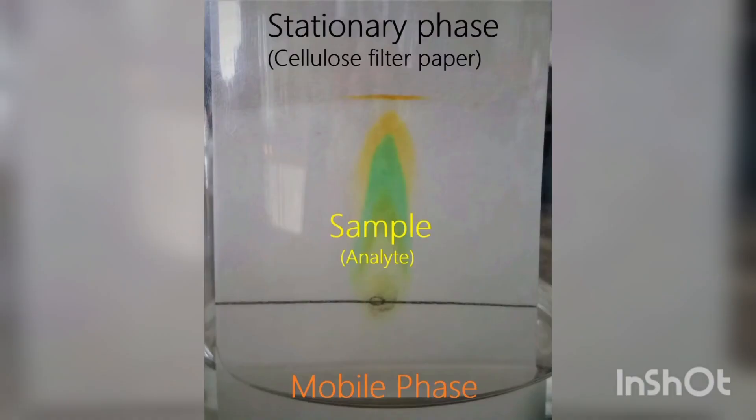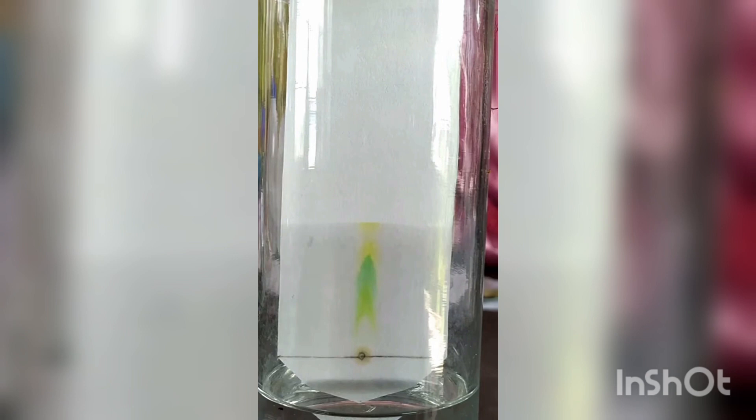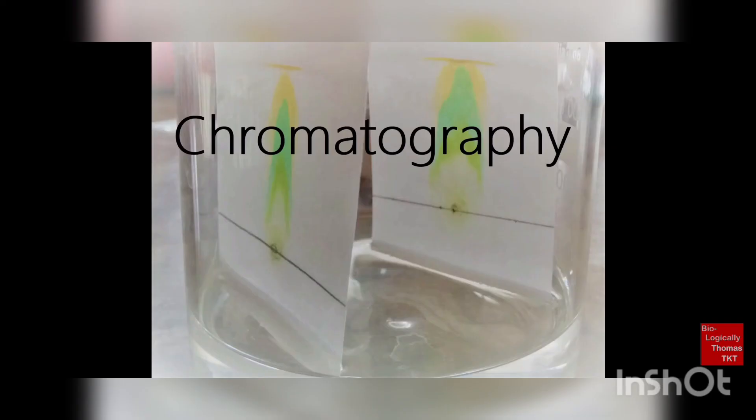There are two phases: stationary phase and mobile phase. We will also perform this experiment. You can also use a test tube instead of the jar, because you get similar results. Here you can see the movement of the solvent and the colored pigments.